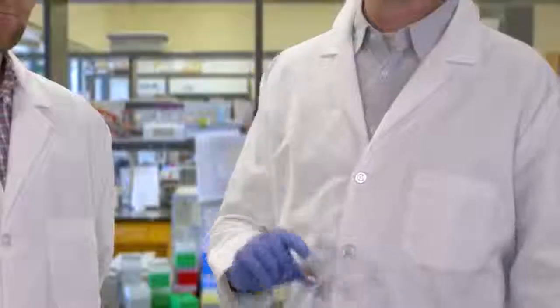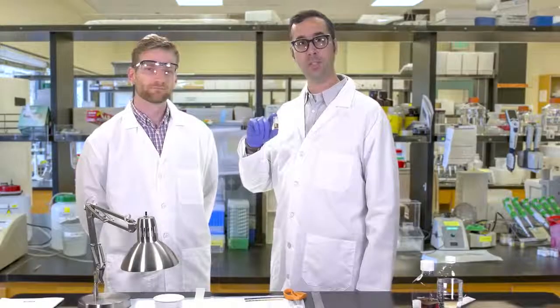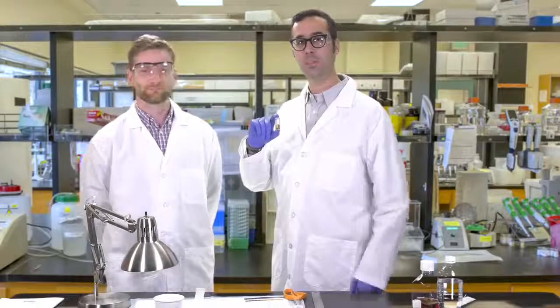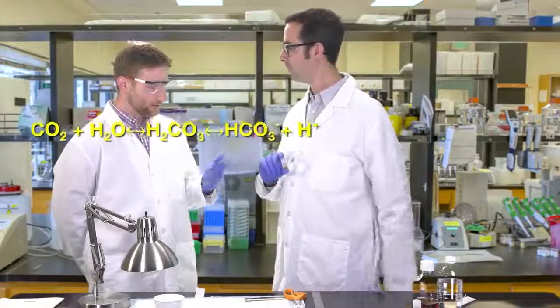Wait, why would carbon dioxide change the color? Well, actually, this is a pH indicator. Do you know how a pH indicator would detect CO2? Here's a hint. Okay, I'll think about that later, but how do we use algae beads in an experiment?